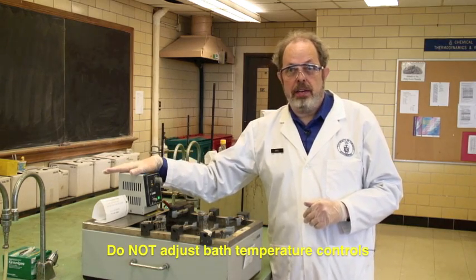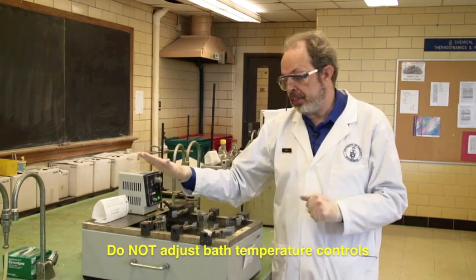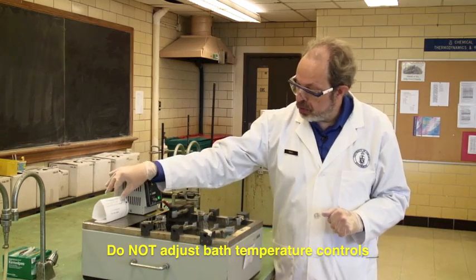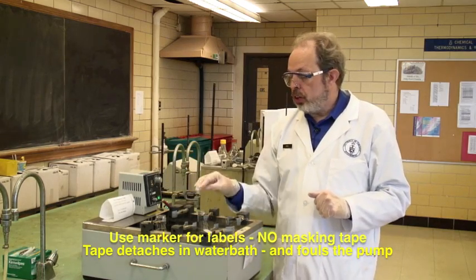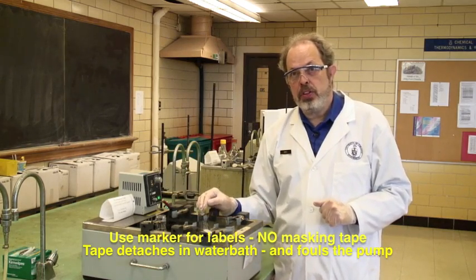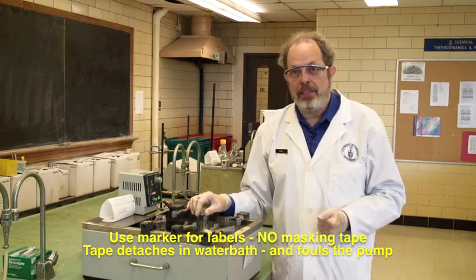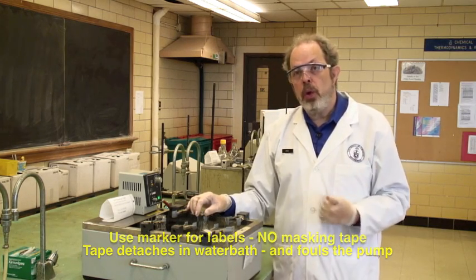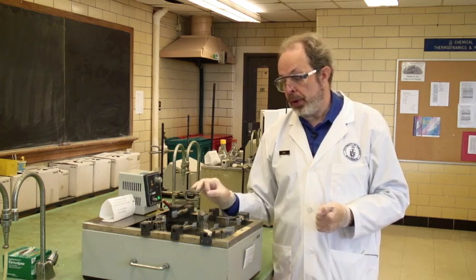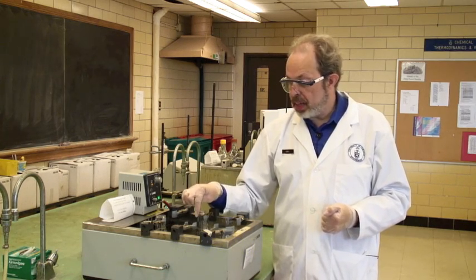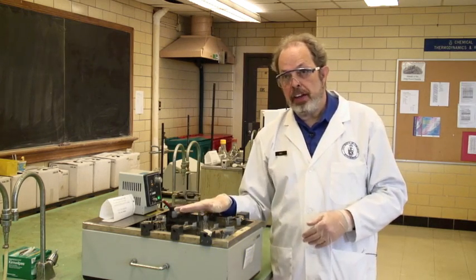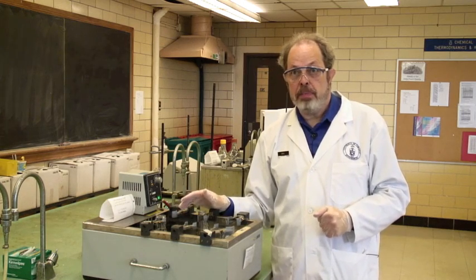Don't adjust the temperatures. They've been pre-set. The other thing you may notice is this sign here. Don't use masking tape to label your flasks. Now, I'm the only one here, so I haven't bothered labeling them, but when you're working with other people, use a marker. If you put masking tape on these, they soak off in the hot water, and it fouls the pump.